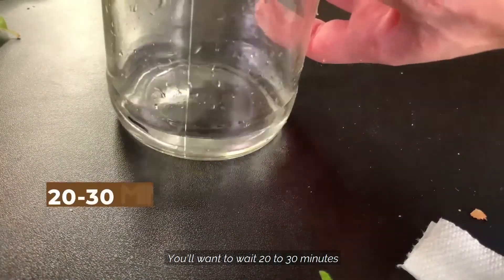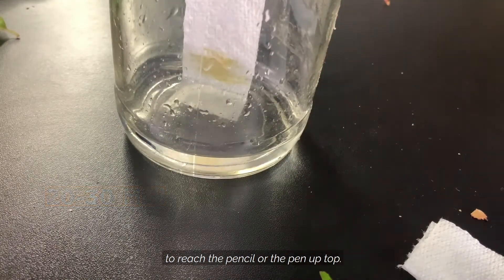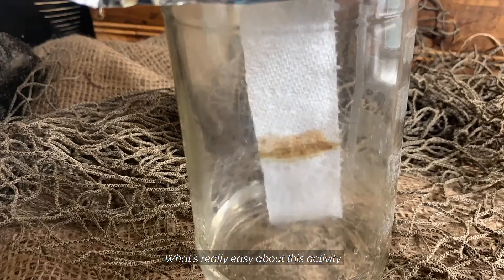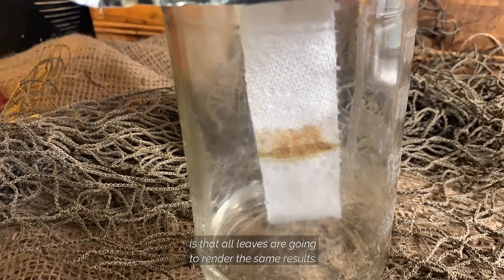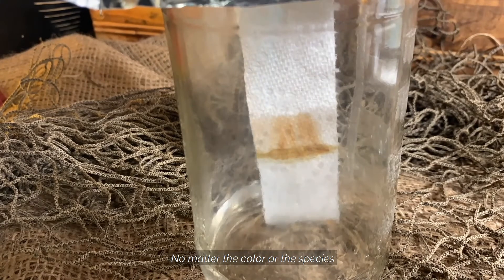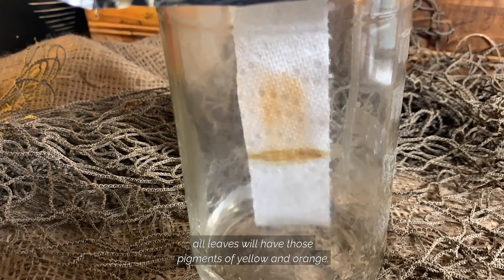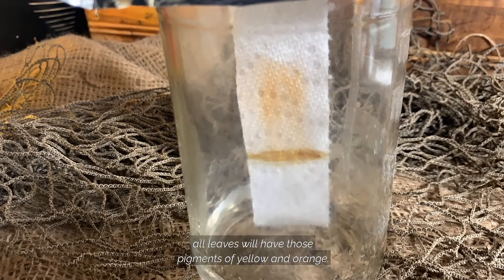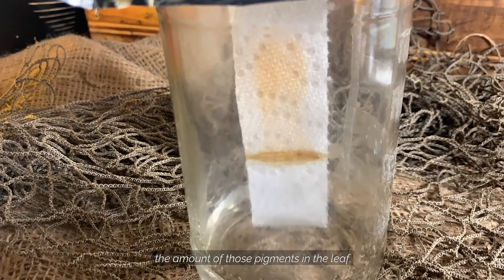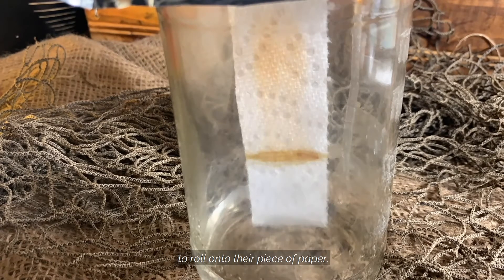You'll want to wait 20 to 30 minutes for the pigments to run up the paper; however, you do not want the alcohol to reach the pencil or pen at the top. What's really easy about this activity is that all leaves are going to render the same results. No matter the color or the species of tree that you pull the leaf from, all leaves will have those pigments of yellow and orange. The intensity of the colors will depend on the amount of those pigments in the leaf and how much pigment the students were able to roll onto their piece of paper.